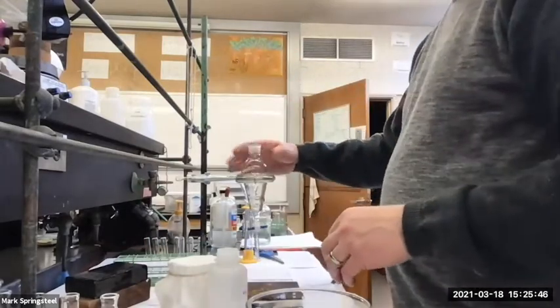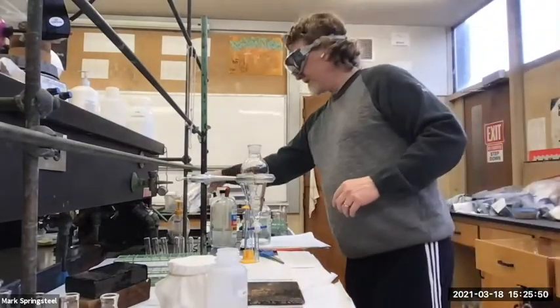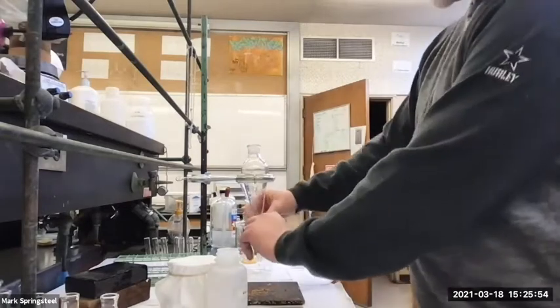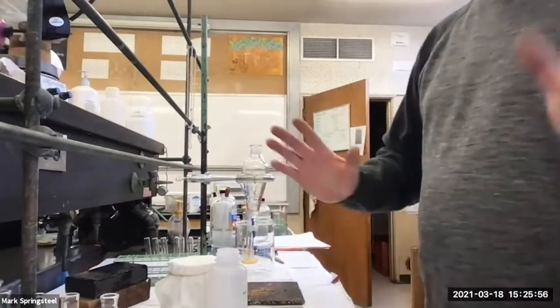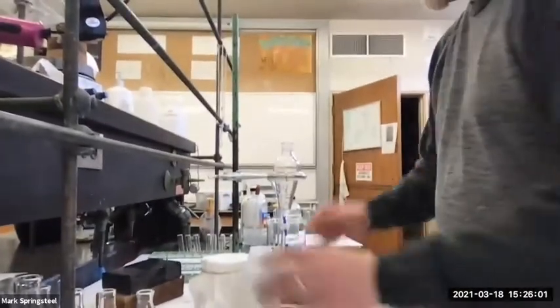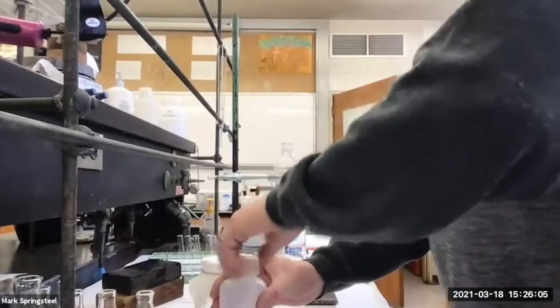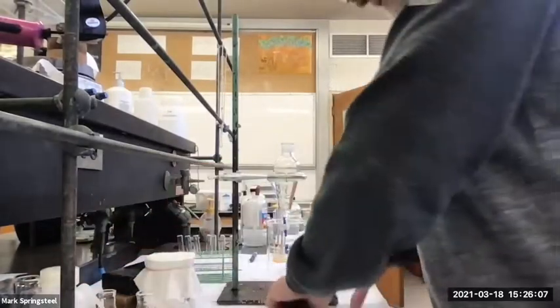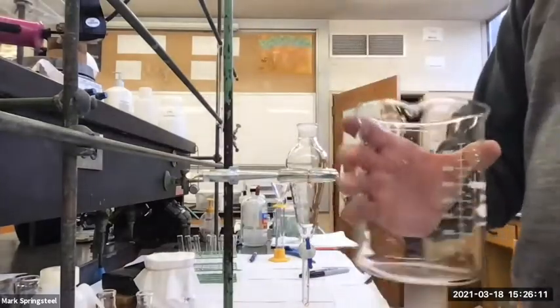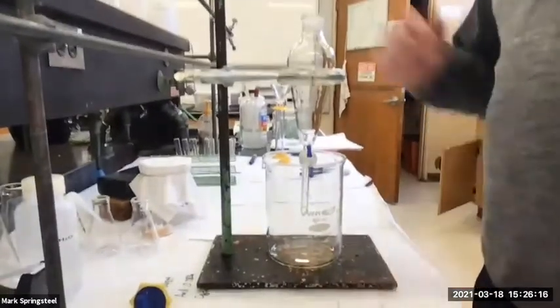Okay, and something that happens all the time in extractions is you make the mistake of adding something while your stopcock is open. It happens all the time. So since it happens so much, and I don't want it to happen, I'll tell you what we're gonna do. We're gonna use this technique to save us. We're gonna put a security blanket under this. We're always gonna have a large beaker underneath our extraction setup. So we've got that large beaker there.